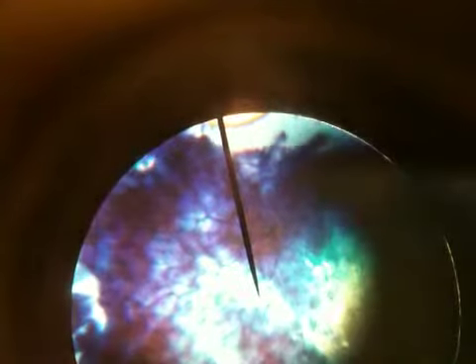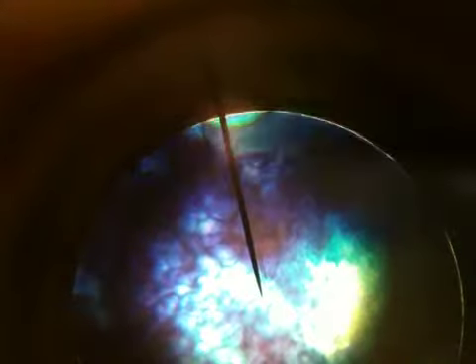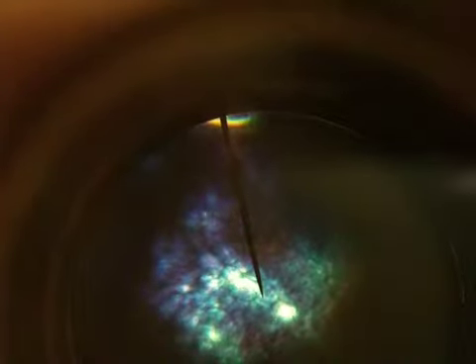Okay, and the microscopes also have the aperture, the diaphragm adjustment, so you can adjust the light that is coming into your sample. And what it does is it gives you a different contrast so that you can see things differently without being blinded. Okay.